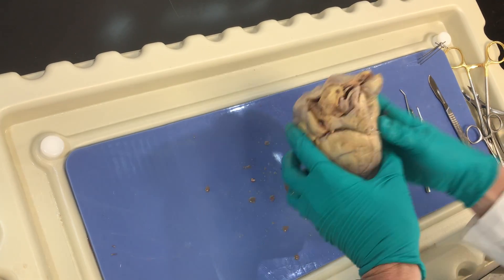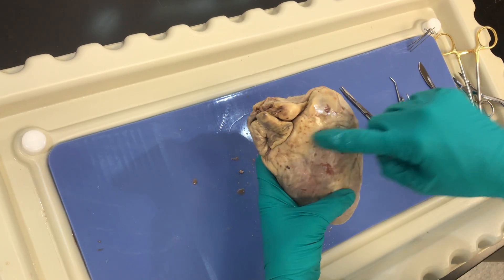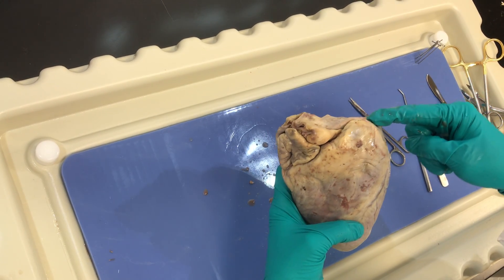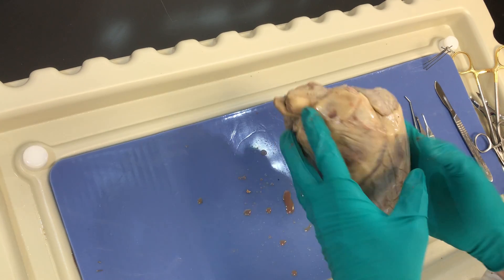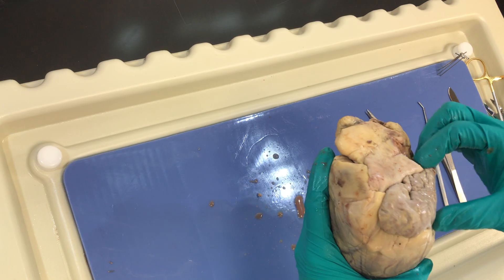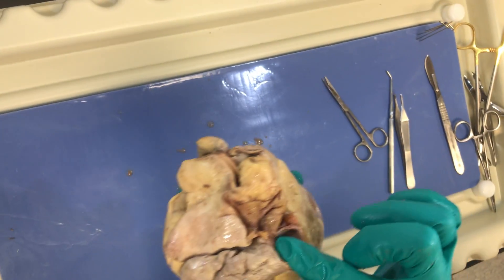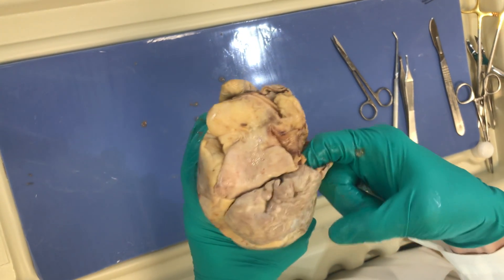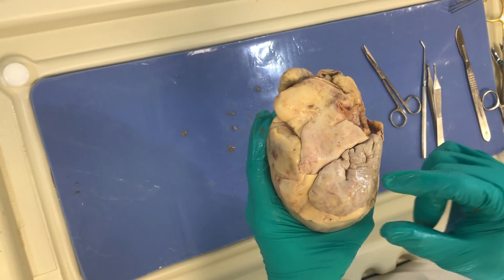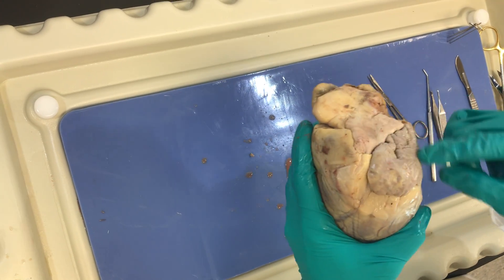Going back 90 degrees to reorient myself: I have my coronary vessels here, right ventricle, left ventricle, right auricle, left auricle. If I do another 90 degrees, I can orient myself externally — I've got my left auricle. Remember, what is the vessel that's going to be emptying into my left atrium? This is going to be one of my pulmonary veins right here. Remember: veins return to the heart, arteries leave the heart. So this is my pulmonary vein and this is my left auricle.